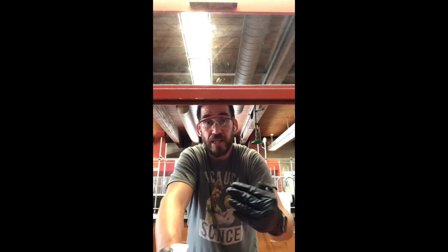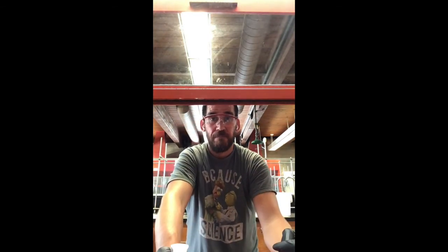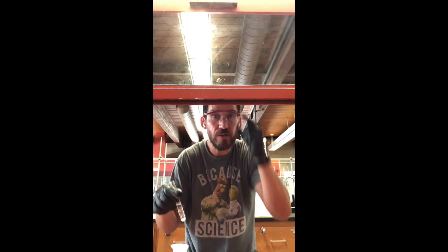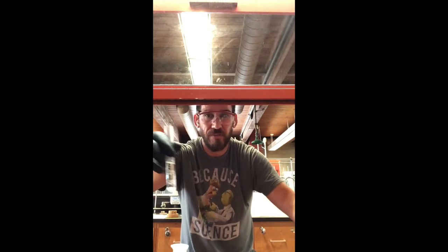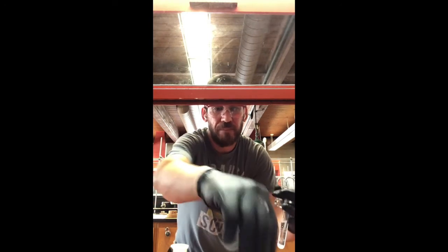And that's just in case I get anything important left in that sodium sulfate. Okay, I'm not going to do that. I'm letting you know, if you put a significant amount of sodium sulfate, meaning 3 to 4 spatulas full, then you might want to consider rinsing it. That being said, if there's any loss of product, maybe that's where it went. Who knows? Keep that in mind. These are the things that you want to think about as you're doing this work. Because if you don't get 100% yield, which you never do, where did it go, right? It had to go somewhere. Conservation of mass has to still be there, right? So that's one possible thing.